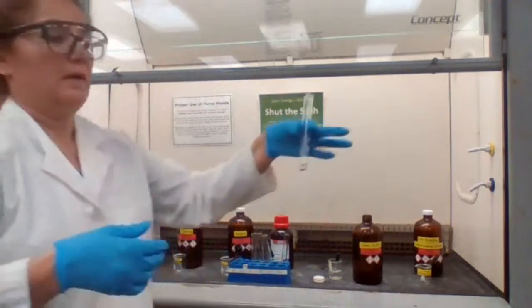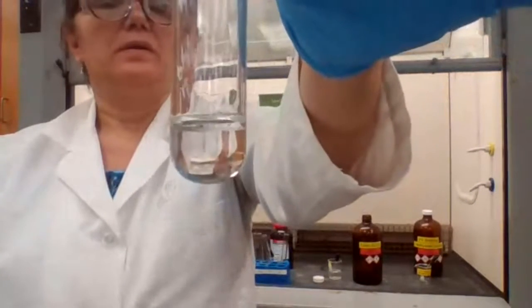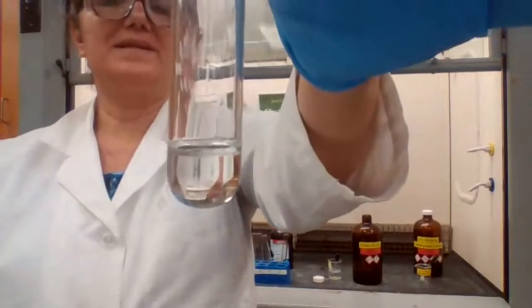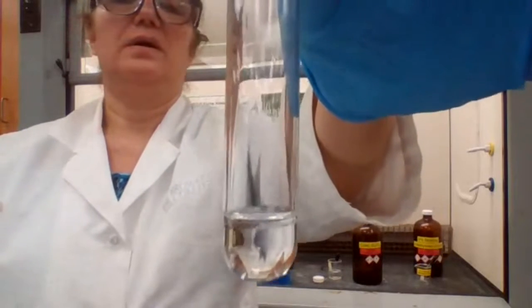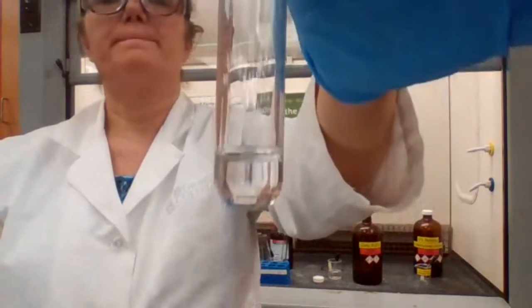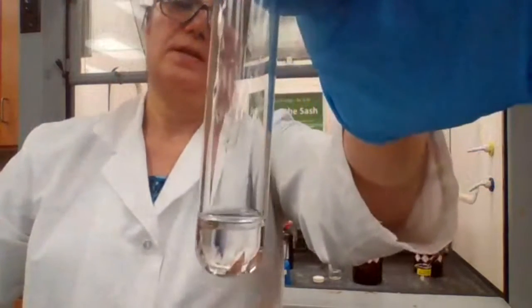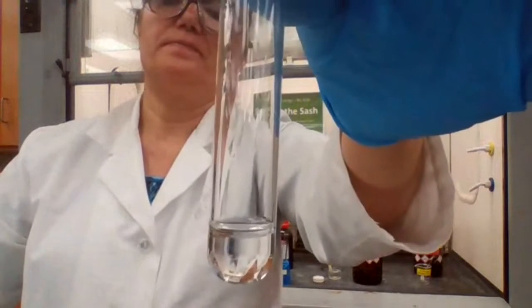Okay, I have 5 drops of hexane and 1 milliliter of sulfuric acid. Record your observation.